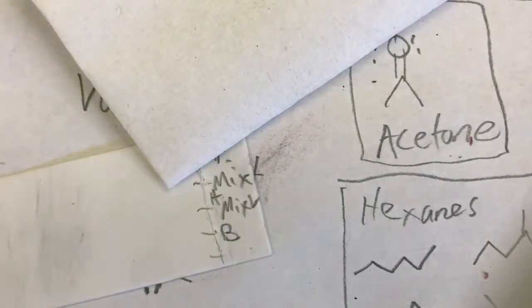There it is, done. Now I will bring it over and look at it under the UV light to make sure I did a good job and got enough sample on each one. So I have it in there, turn it on, cover up the front so the camera is better. Okay, so let's zoom in on this. It looks good. If you look carefully, you'll see the spots where I spotted them: benzophenone, the mix light, mix heavy, and the vanillin.